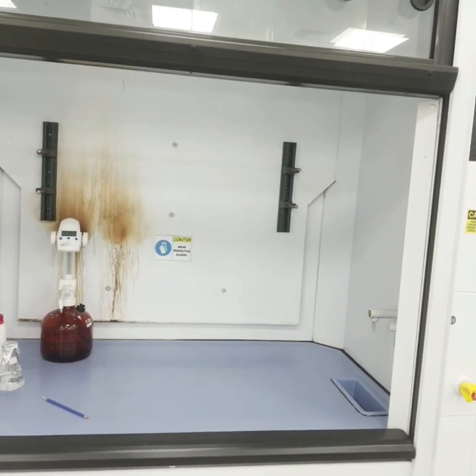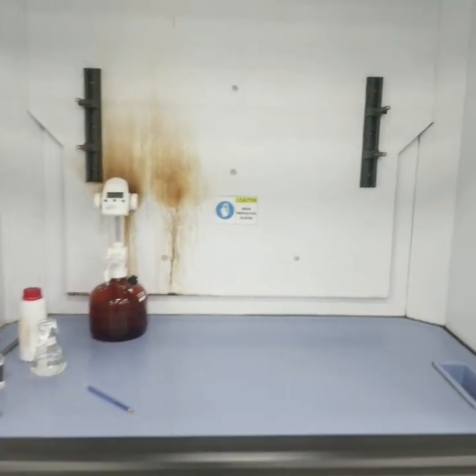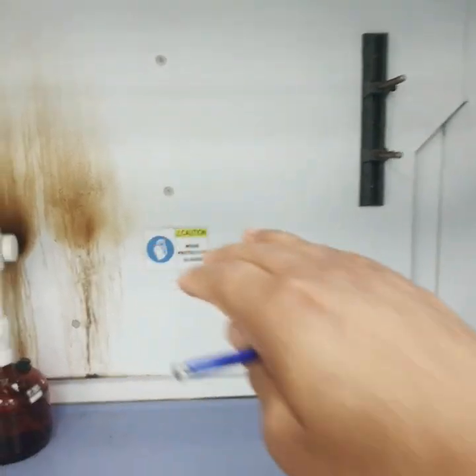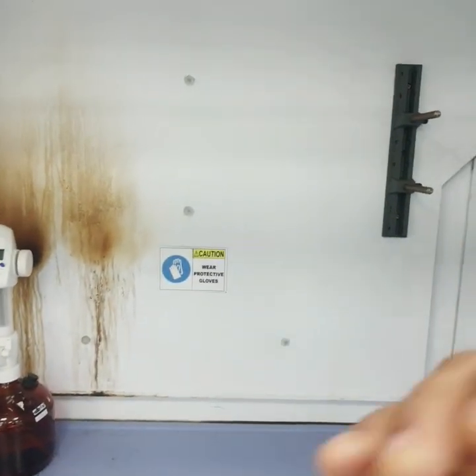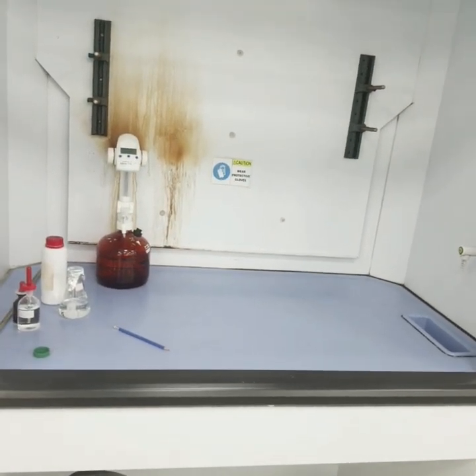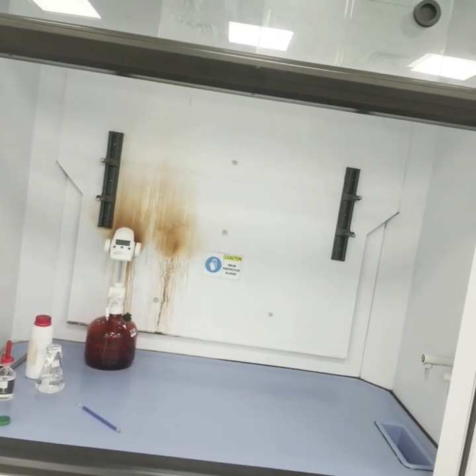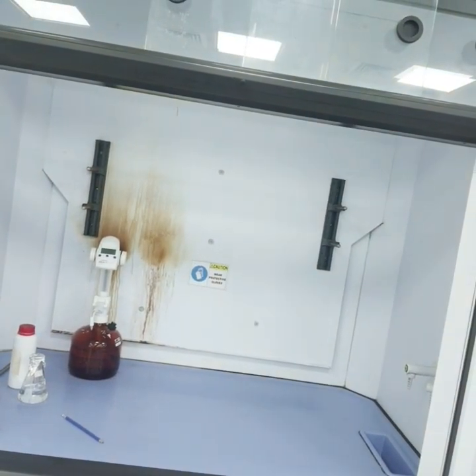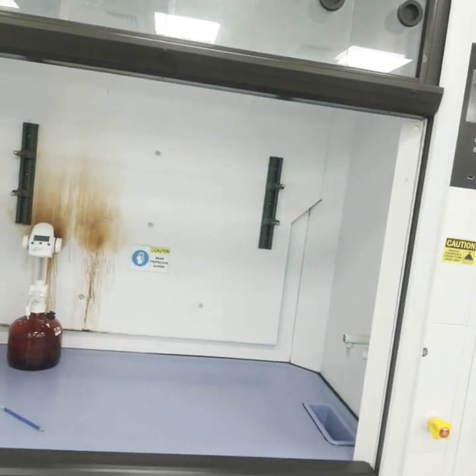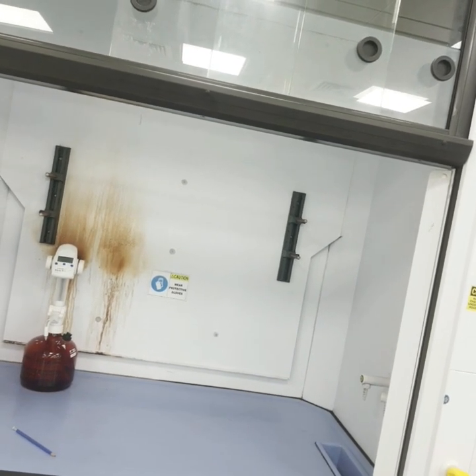The proper use of the fume hood sash can also shield the worker from an uncontrolled reaction. It is generally recommended that fume hood face velocity be between 0.3 meters per second — which is 60 fpm — and 0.5 meters per second. This is the accepted range of face velocity.